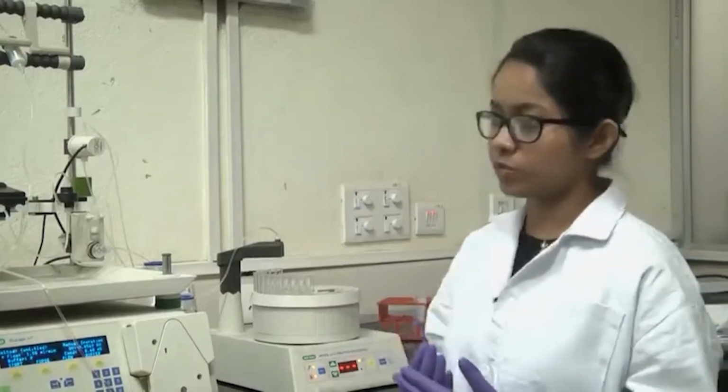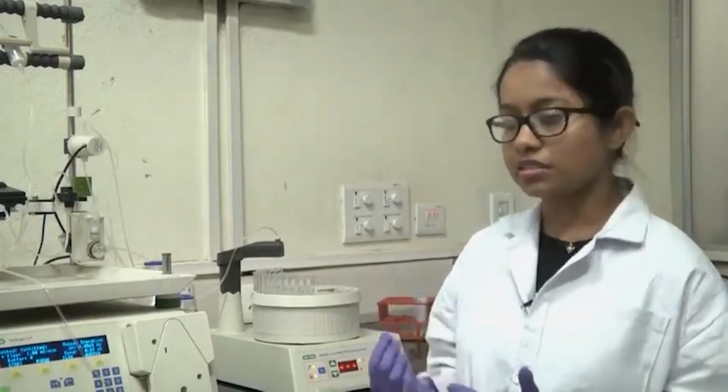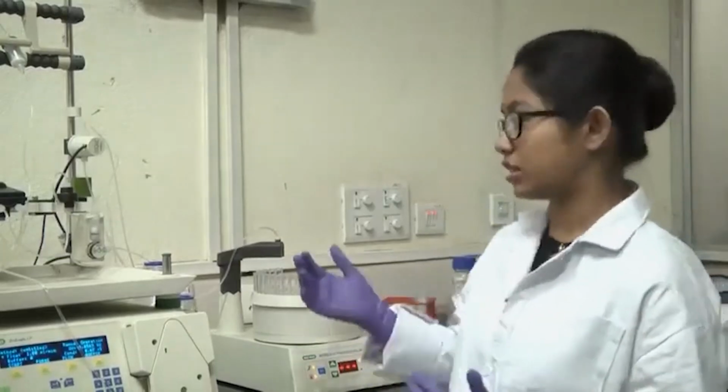And from the UV absorbance, you will see at which fractions you collect a higher amount of protein. If you have 6x His tags, it takes around 200 to 300 millimolar of imidazole, and you will select those fractions which have your protein of interest. You run an SDS-PAGE gel to see if your protein of interest is there, and whether it is purified or has other contaminant proteins. So, if you got pure protein in those fractions, you concentrate it down because the volume will be much higher. You concentrate your protein, or then you go for other procedures like buffer exchange and other steps for your own experiment.